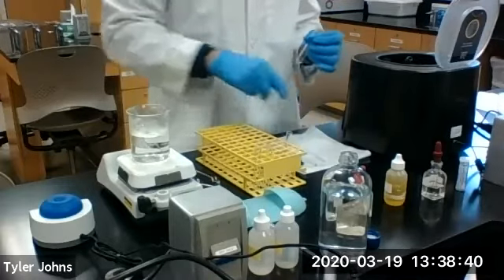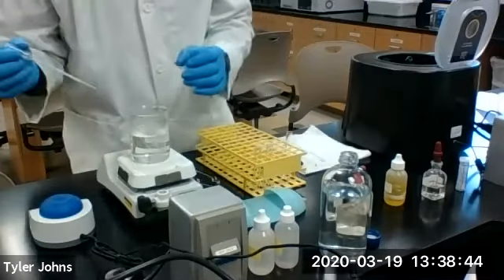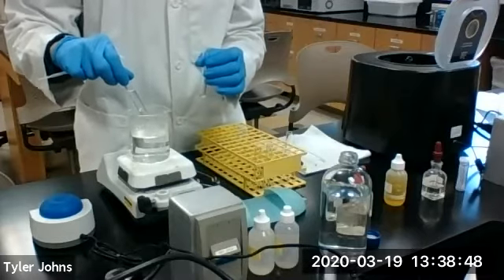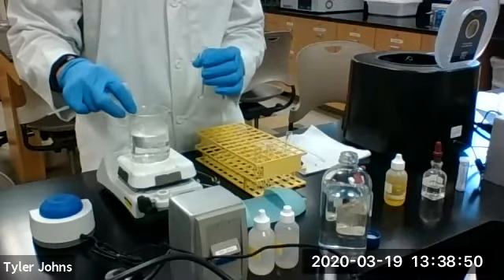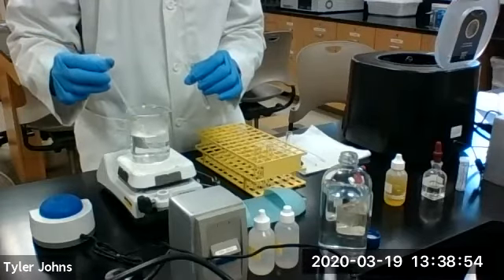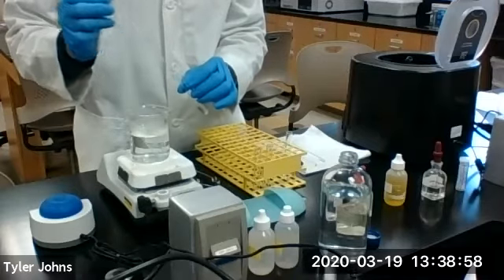We're going to wash R2 with several portions of boiling hot deionized water. I have a test tube right here that I've been boiling with deionized water in it. So we'll wash.